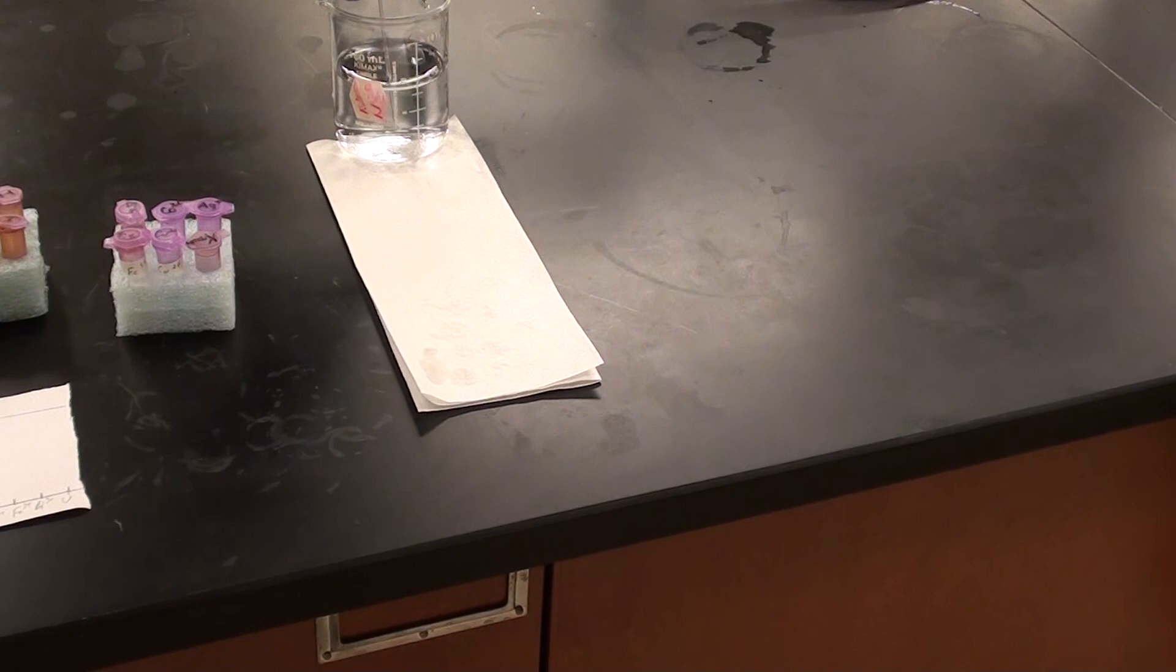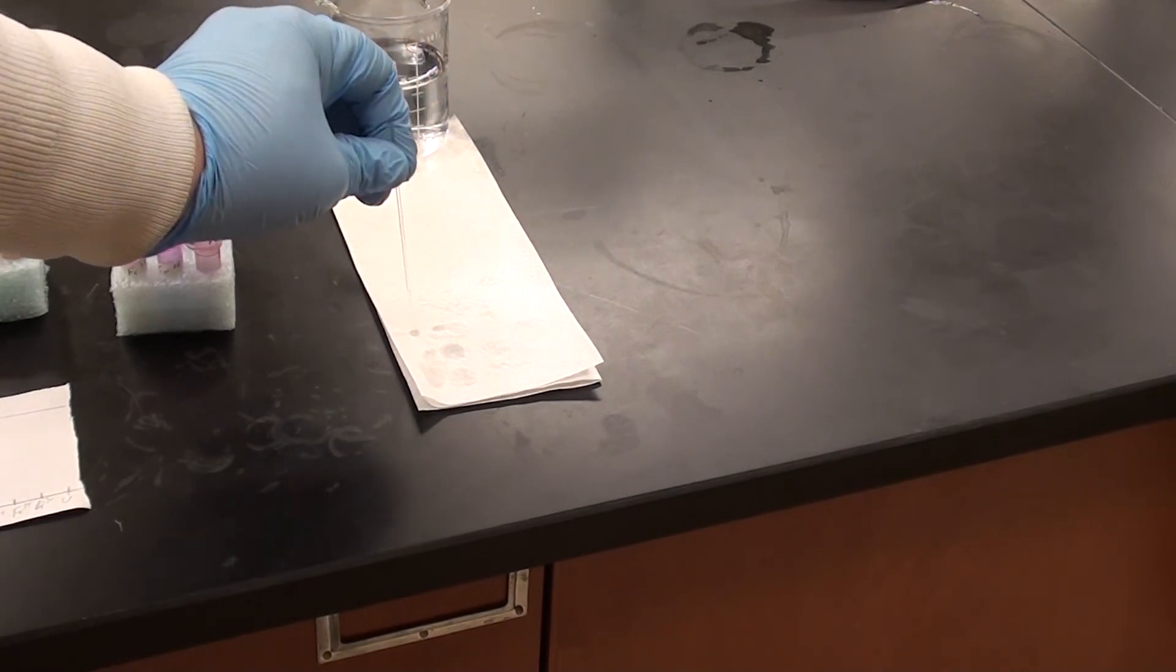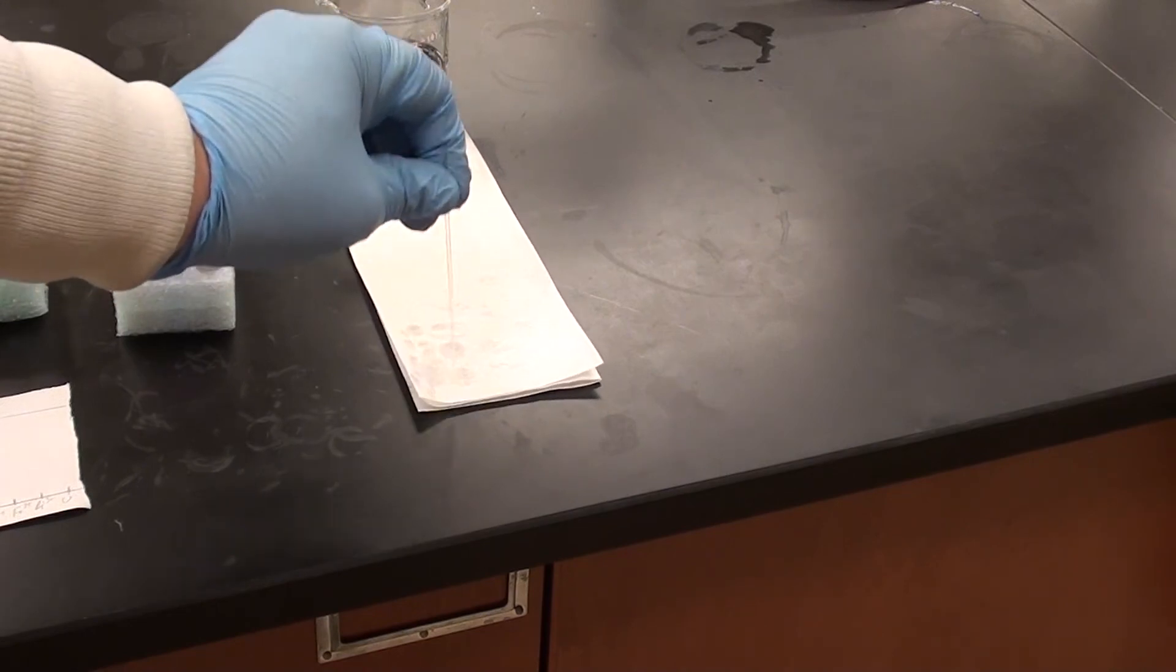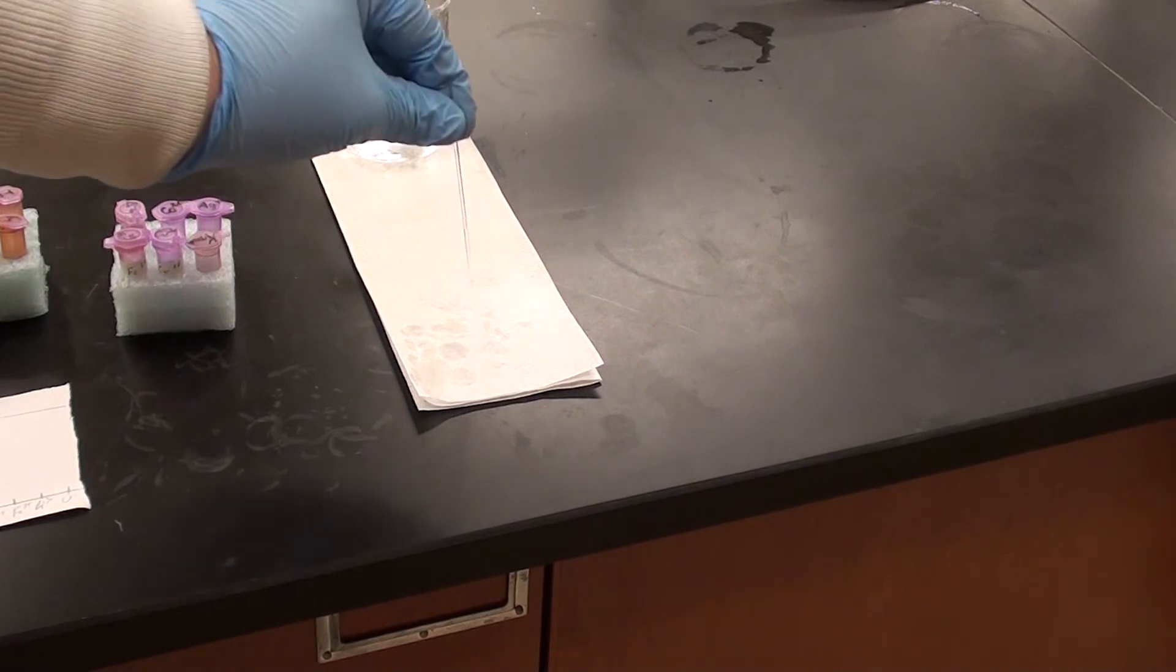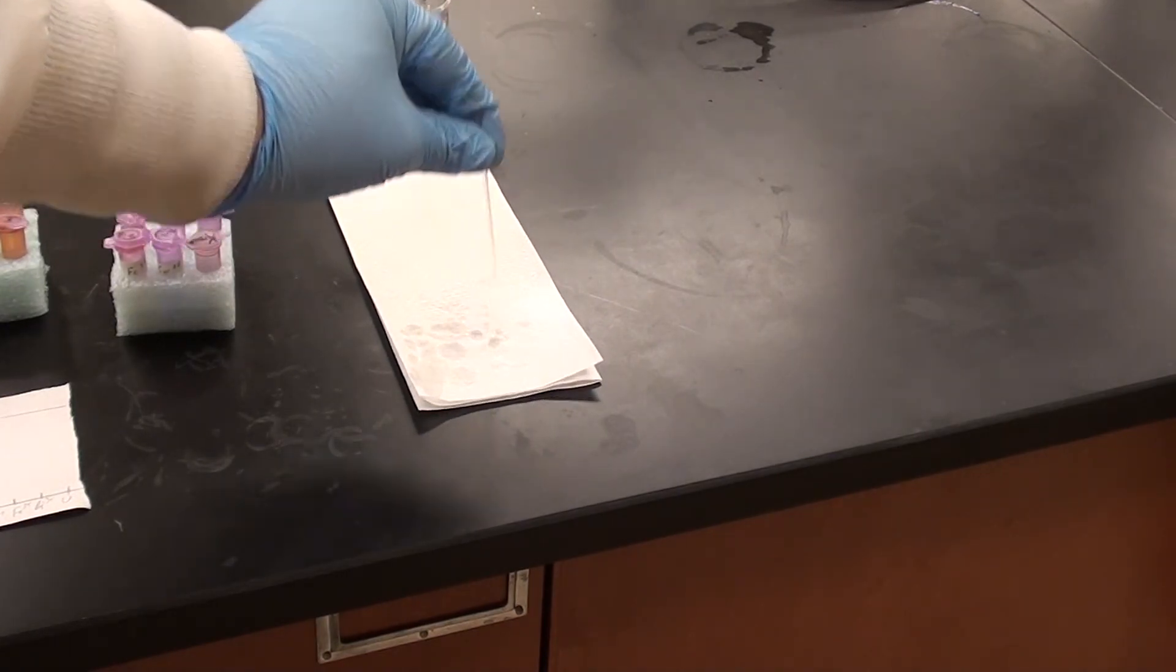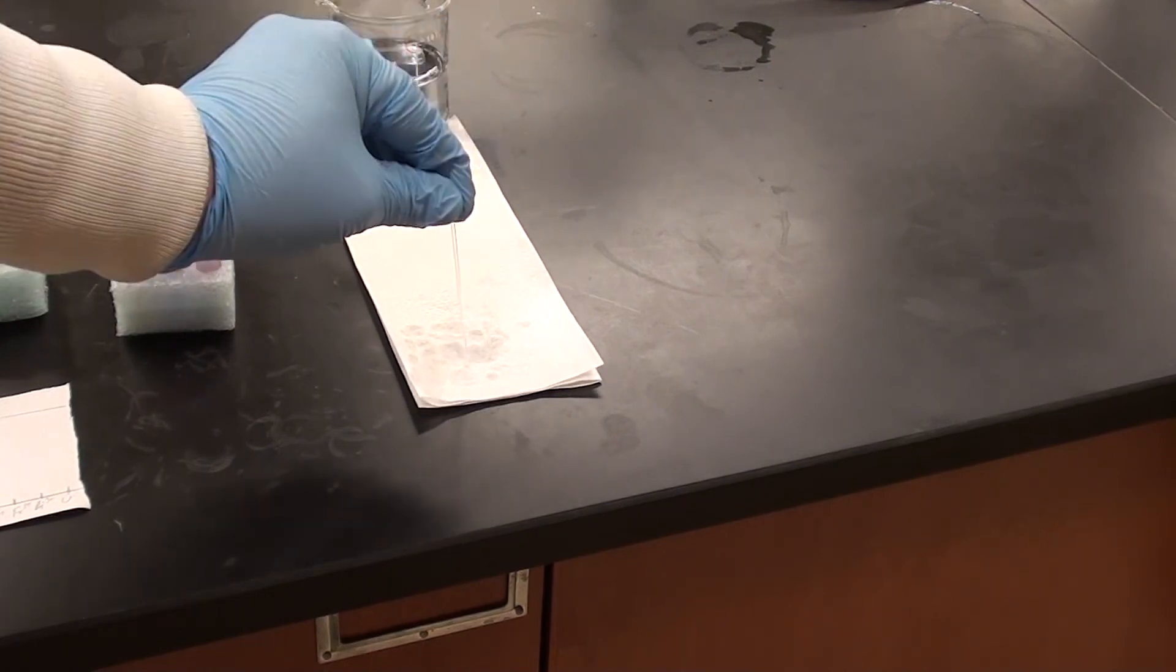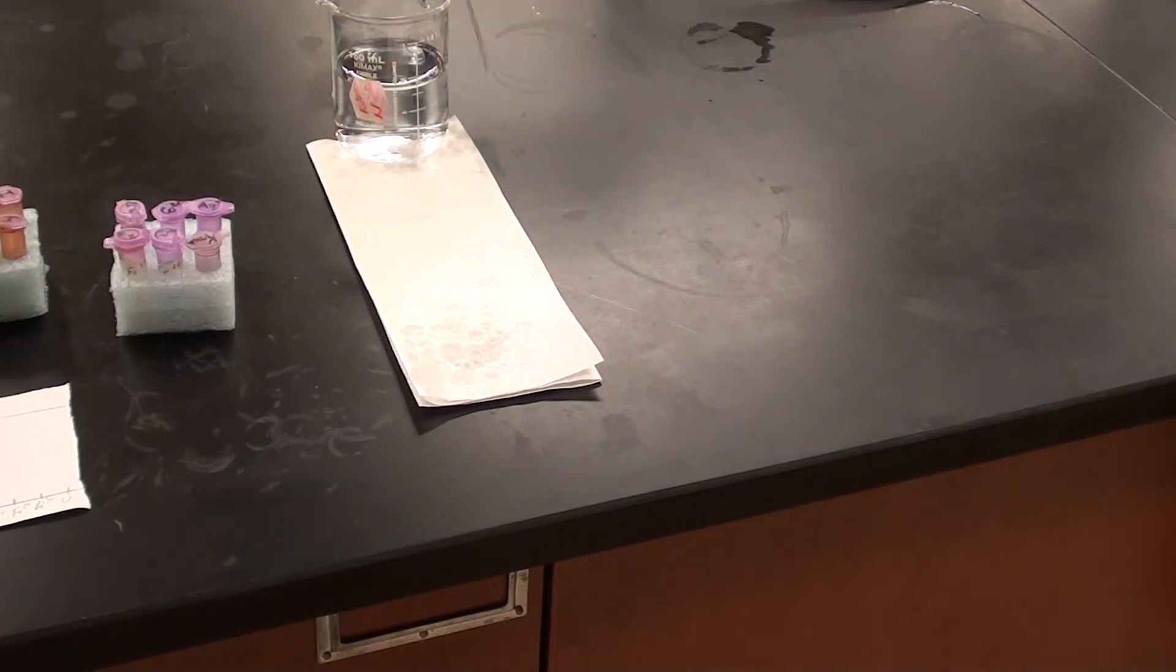So I'm going to fill that now with water and again just dip it in, pull it out and just touch and tap the water onto the paper towel, thus emptying it and cleaning the capillary. We don't want to get a new capillary each time, that would be a waste. We can just clean it in between uses. If you do this twice, you should be good. So I just empty it out and then I can go ahead and spot my next sample.